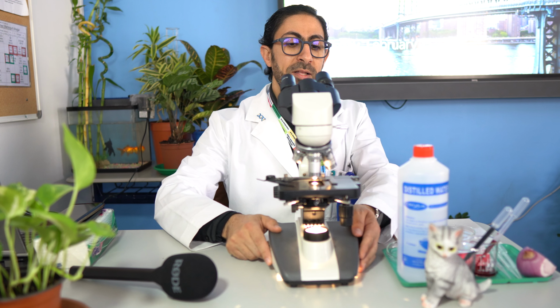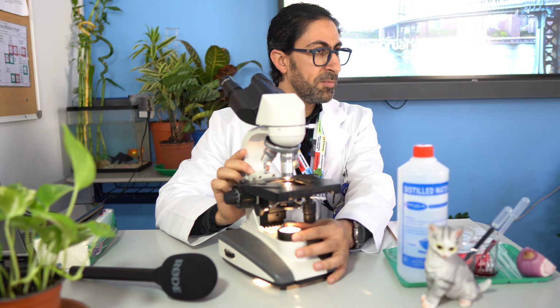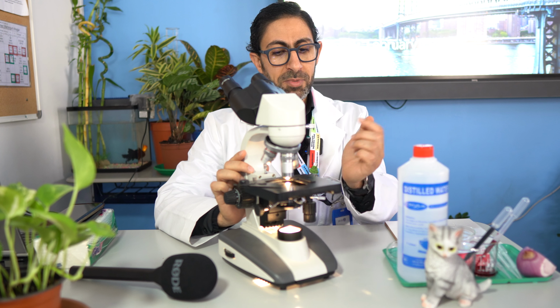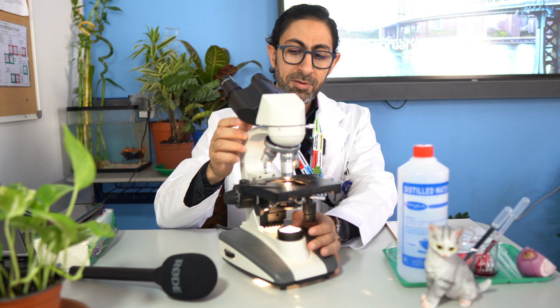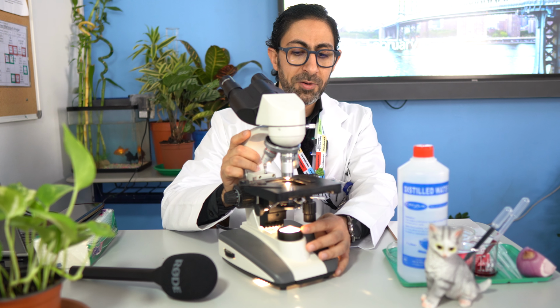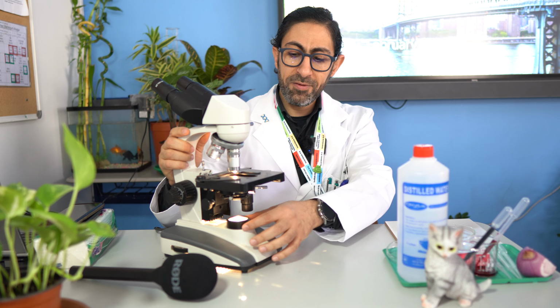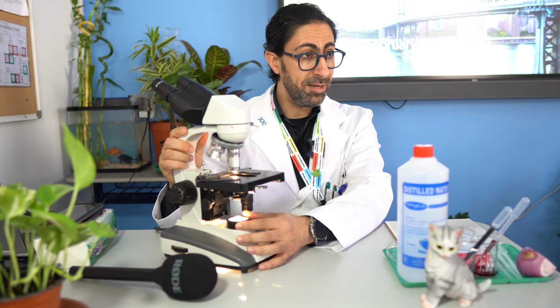First of all, the compound light microscope uses a beam of light. This beam of light has a lot of sources. Maybe the sun, but in that case you're going to have a mirror instead of a bulb. Now in this microscope we are using a light source in the form of a lamp. If we look at the microscope, we find a light source here. In this case it's a lamp.